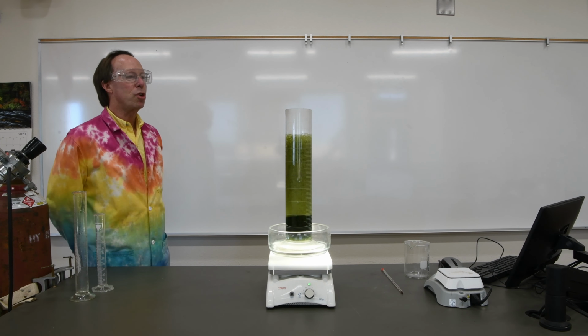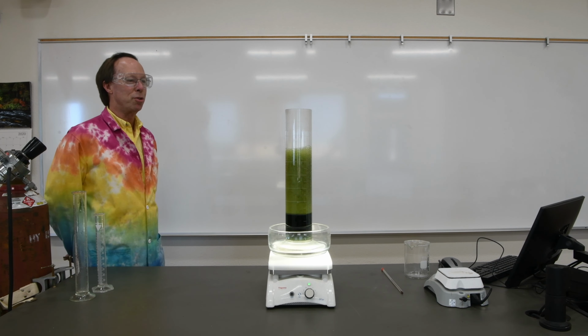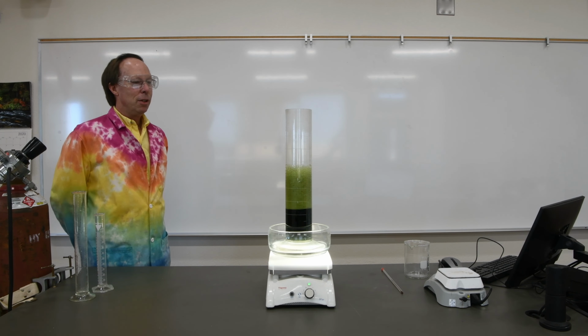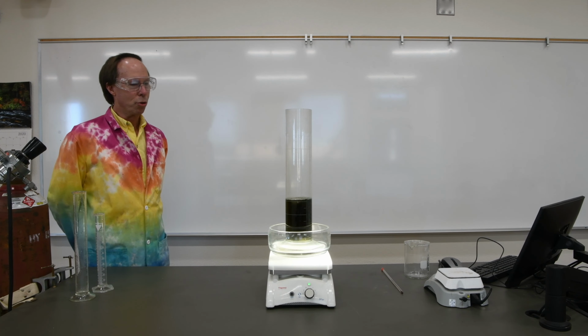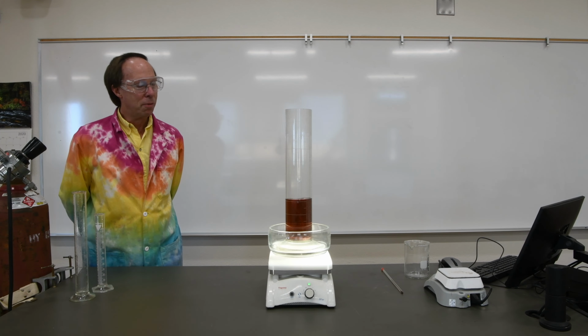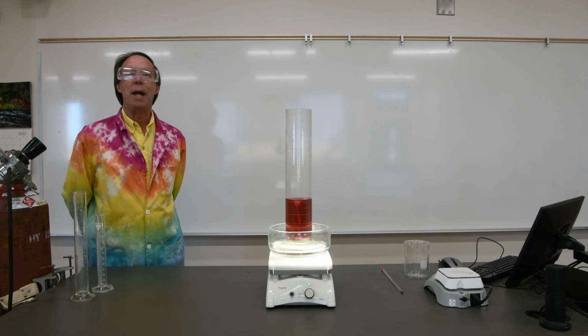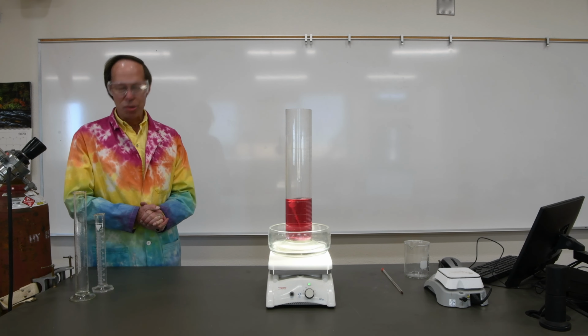You'll know when it's finishing when the bubbles begin to subside, and there we go. The bubbles are starting to drop down. The catalyst has done its job, and now it should return to its original form. We're back to amber, and then very quickly it goes back to that original pink color, which tells us that the catalyst has done what it's intended.